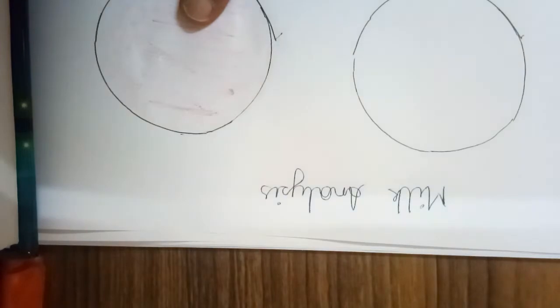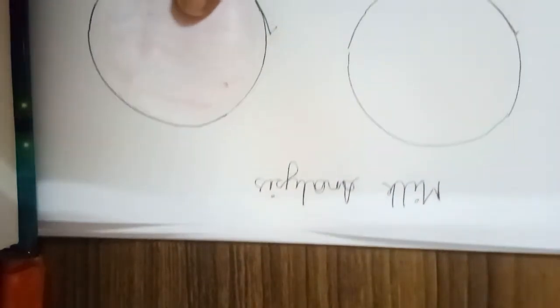First of all we have an agar plate. Okay, an agar plate is colorless and it will not have any color because here only agar, peptone, yeast extract and NaCl are added. Now this is the plate in which we have added dye, indicator dye. This is McConkey's agar plate. Okay, so one by one we will write down the name of media and then we will try to understand.